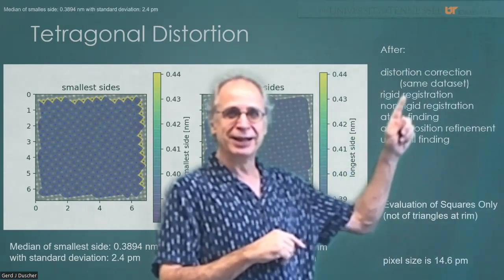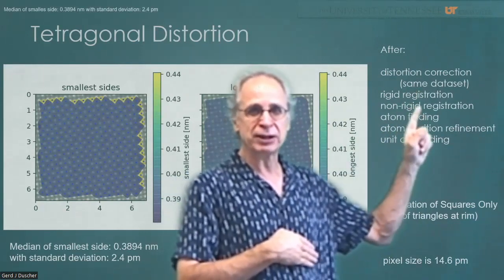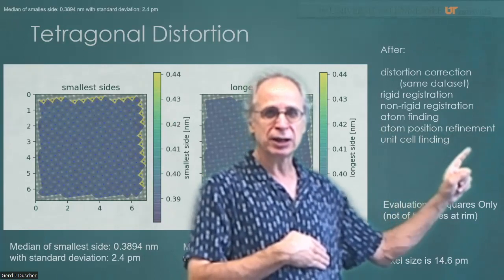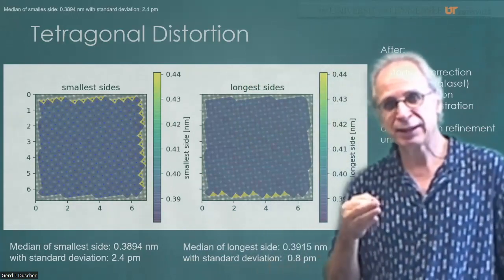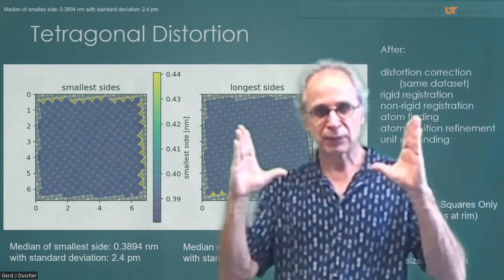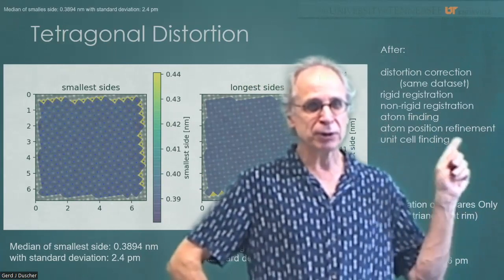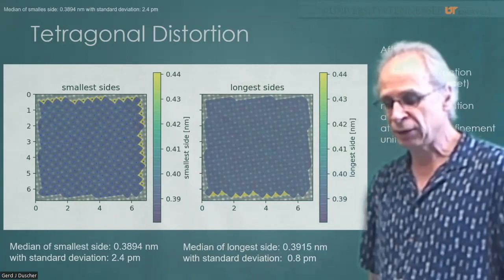Here we have distortion correction, and we did that after we did a rigid registration and a non-rigid registration. We did atom finding, we refined the atom positions, and then we find the unit cells. And since we know exactly how big a unit cell should be in a bulk material, we can then undistort this image. This is a bulk data set, 25 images, and we did that.